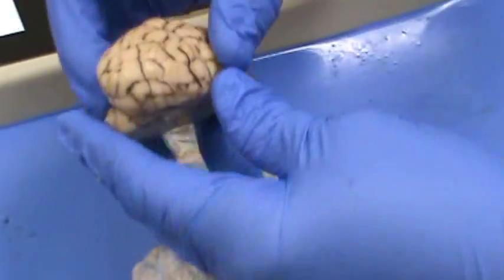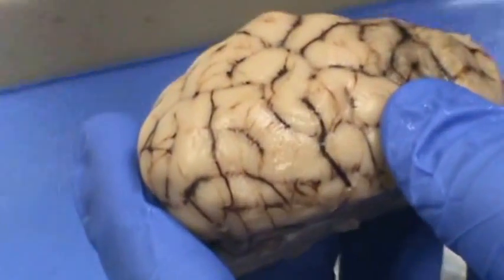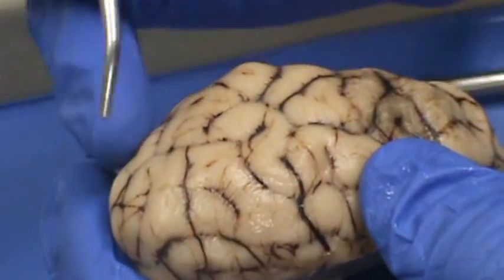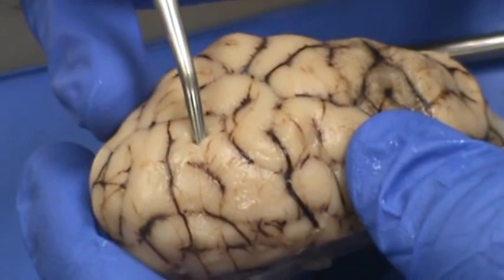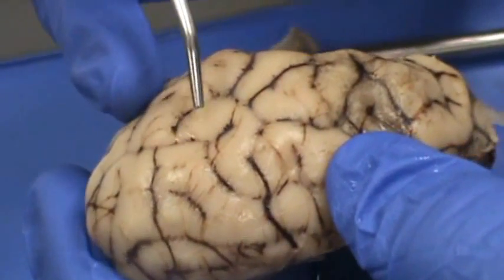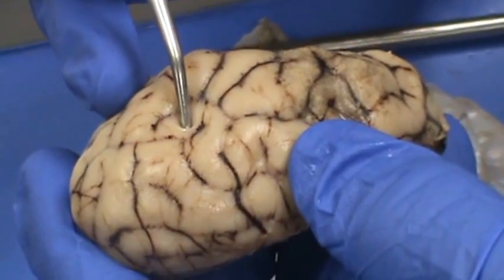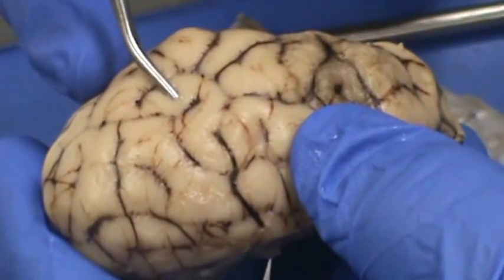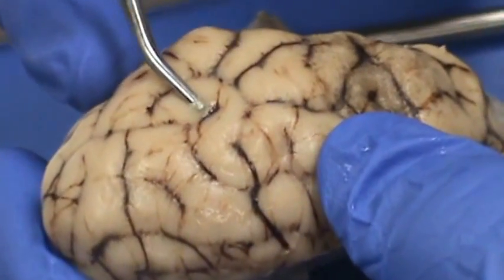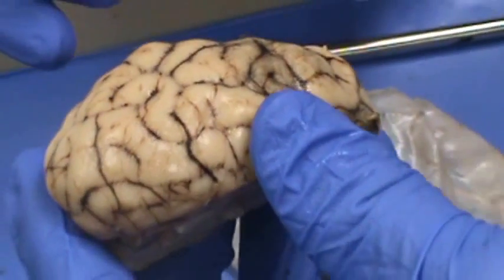The pia mater is the tender thin area that's always going to cover the brain and the spinal cord. You can take a blunt probe and push here and it pops through the pia mater. The pia mater directly covers the brain and spinal cord and you cannot remove it off the brain and spinal cord.